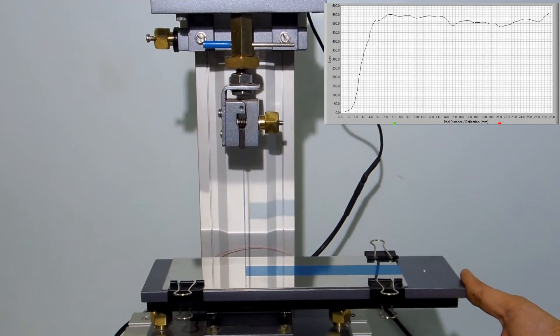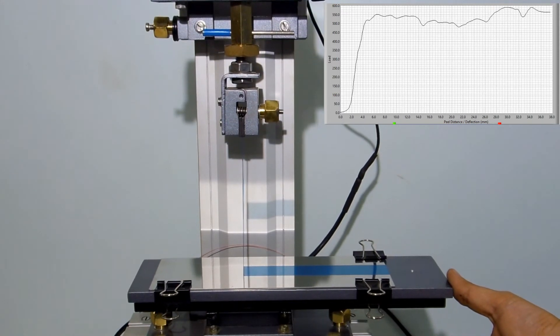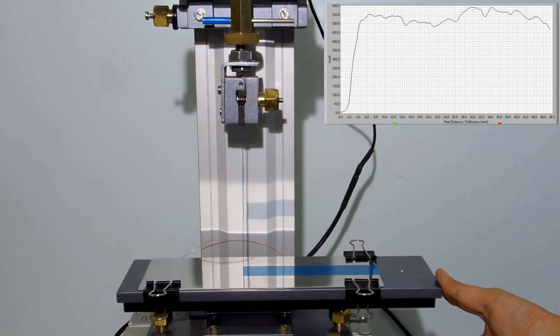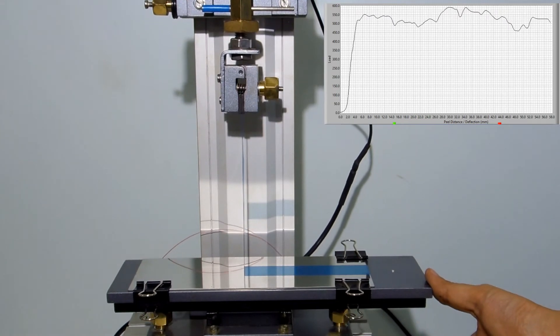As the machine moves up, try to maintain 90 degrees at the sample by pushing the slide assembly towards the left side.